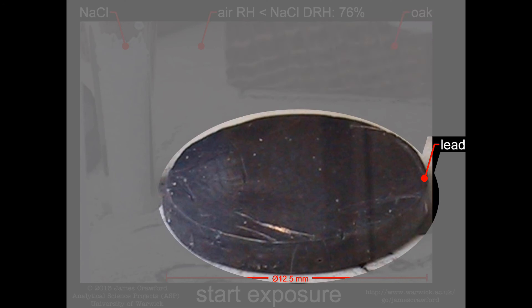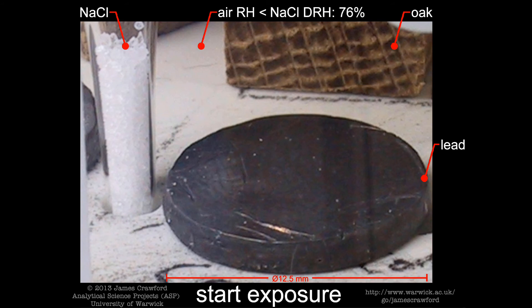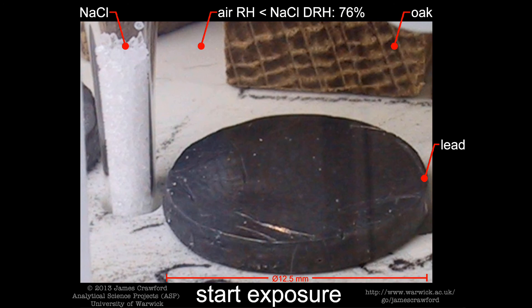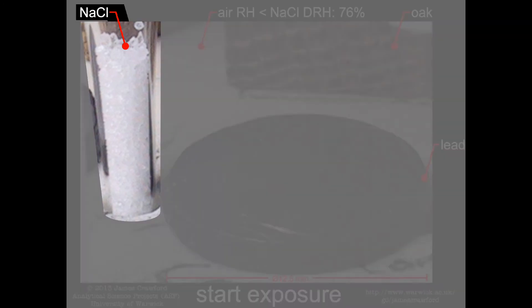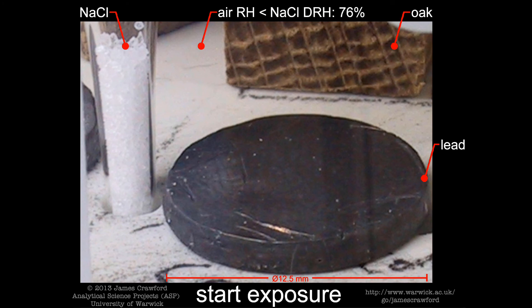The pictured lead and oak are enclosed in a glass chamber together with a saturated solution of aqueous sodium chloride. This salt solution humidifies the air and the oak. Oak is known to emit more volatile organic compounds at higher relative humidities. The deliquescence crystallisation behaviour of the sodium chloride crystals in the open tube indicates a possible upper threshold of 76% relative humidity in the chamber over time.